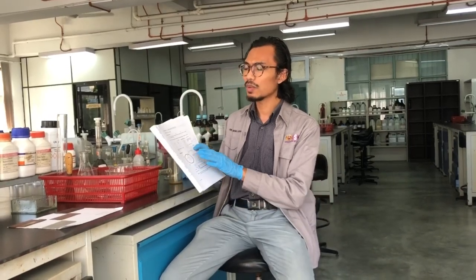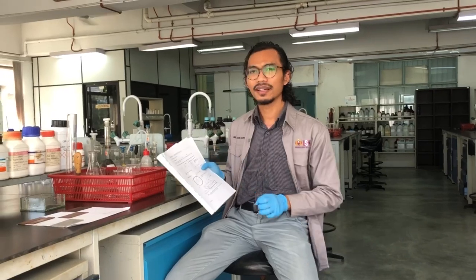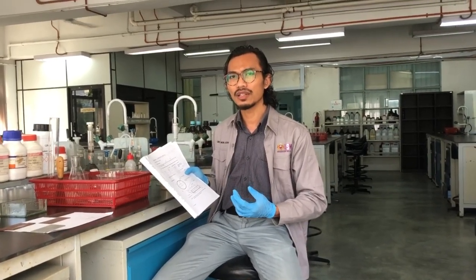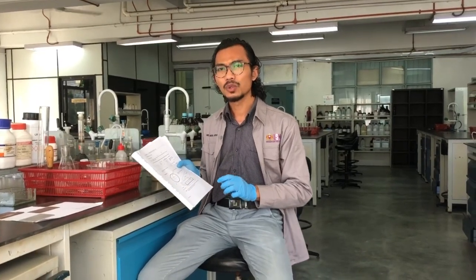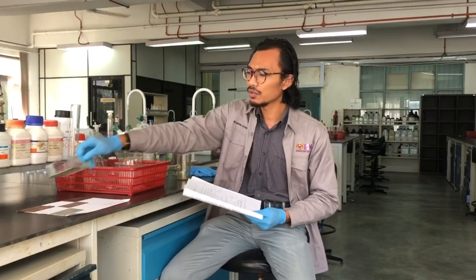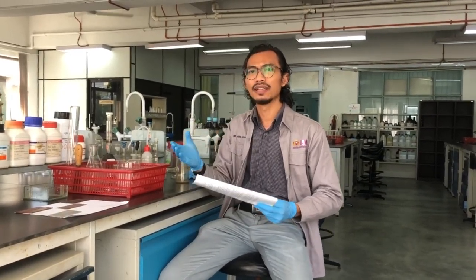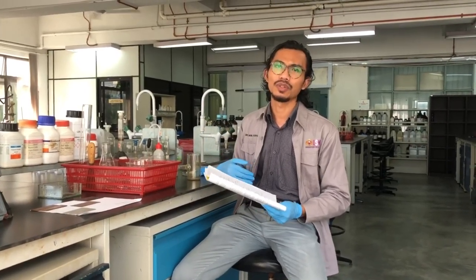For Experiment A1, the metal corrodes naturally — you just put an X mark. For Experiment A2, you will set up an electrochemical cell with two different metals, iron and copper, filled with the ferroxy indicator. You will see which one becomes the anode and which one becomes the cathode based on the color changes.